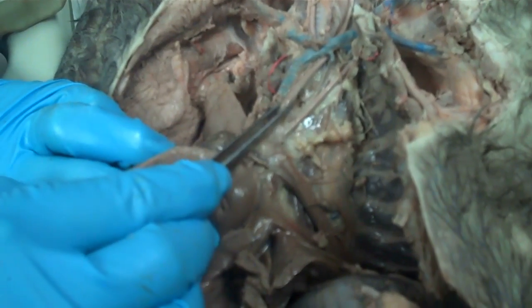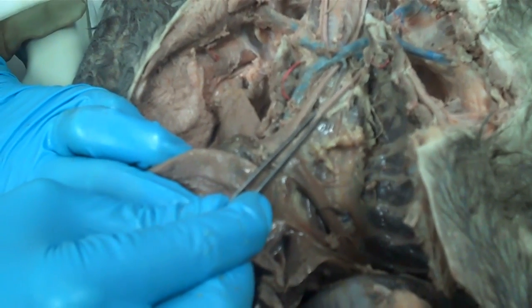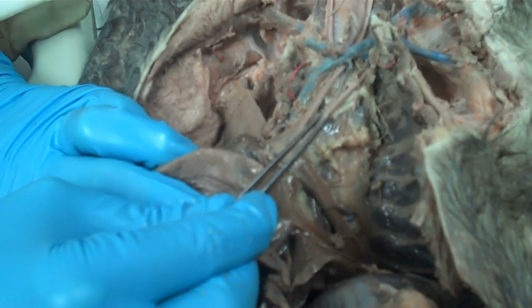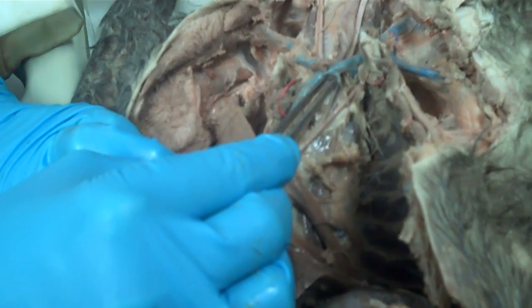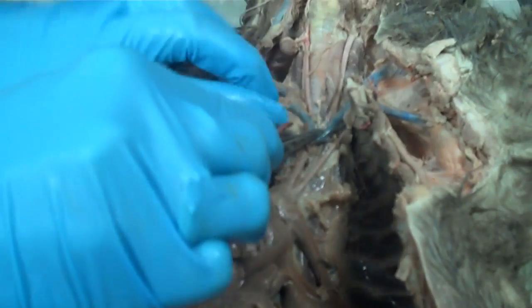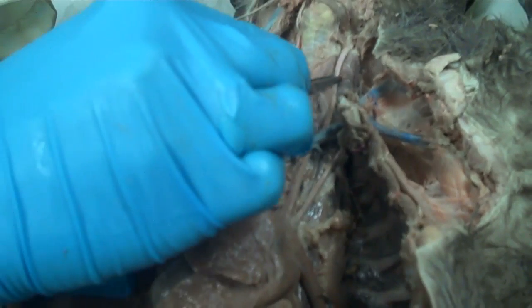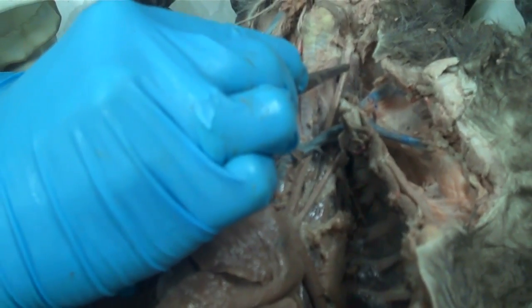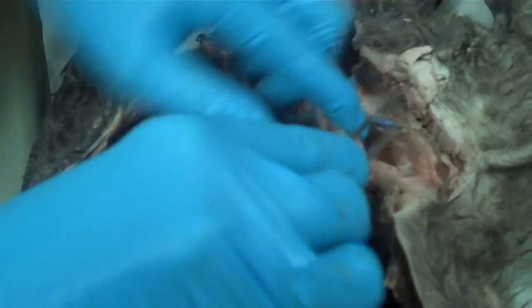The larger one is the brachiocephalic and the smaller one is the left subclavian. If I follow the brachiocephalic up, it's going to branch into the two carotids. If I follow the subclavian, eventually it will just go into the arm.